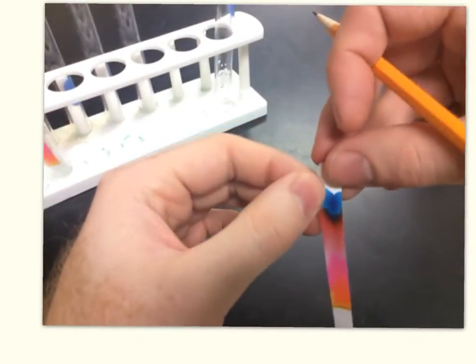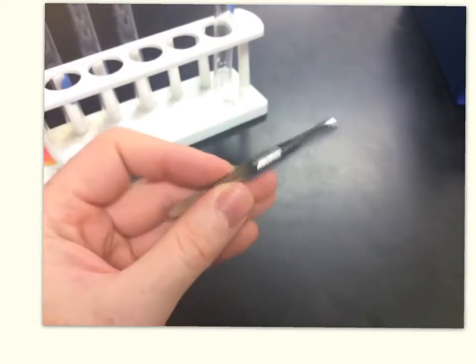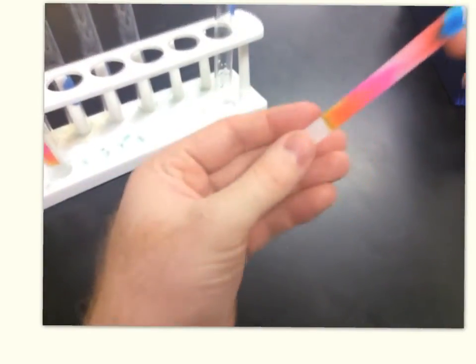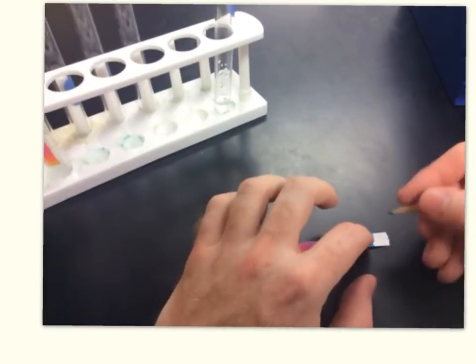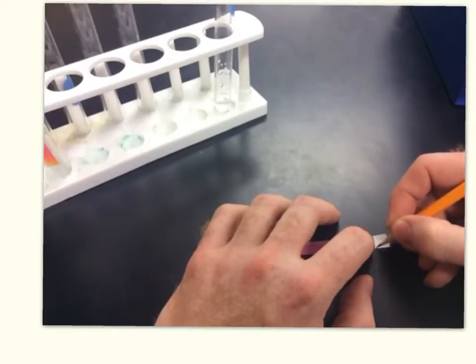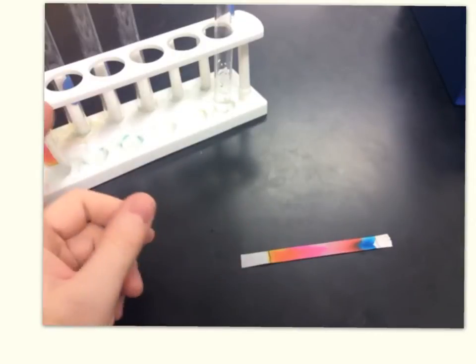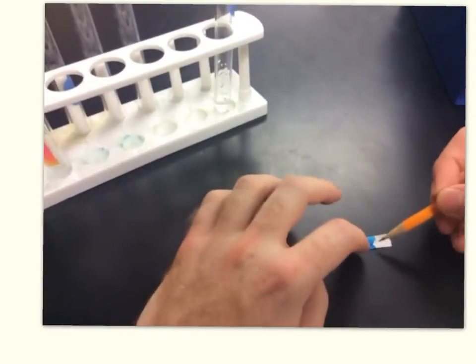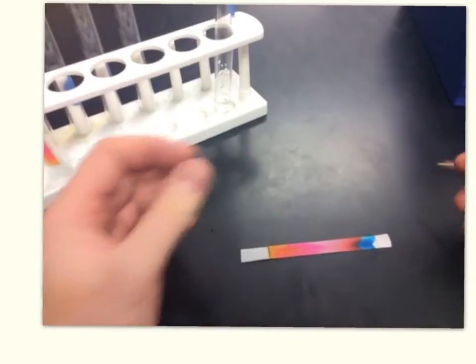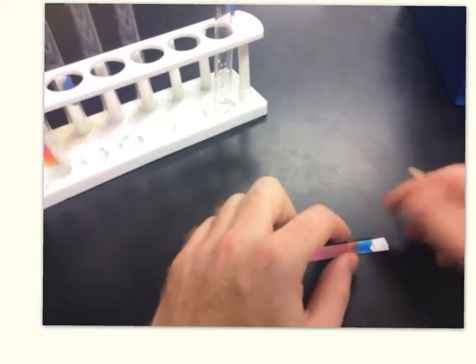When your solvent front has reached near the top of the paper — about this far from the top — take it out of the test tube using the tweezers. Before the solvent can dry, this is super important: take your pencil and mark where the solvent was when you pulled it out of the test tube. Because the water is going to start evaporating as soon as you take it out, and you're not going to know where it was unless you mark it. Look for where the water mark was at the top of the paper — not where the top color is — and mark it as soon as you take it out.